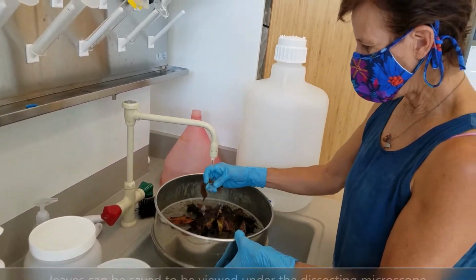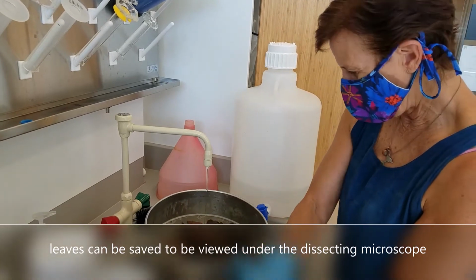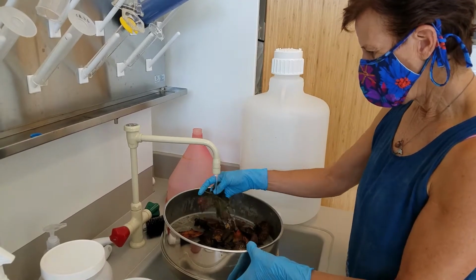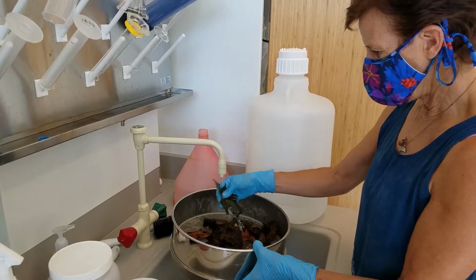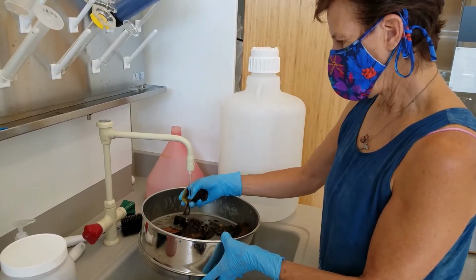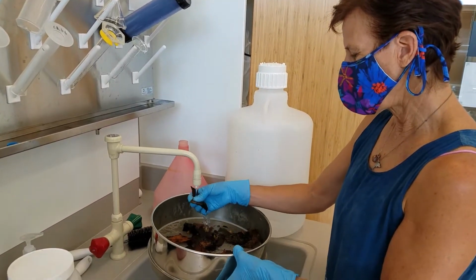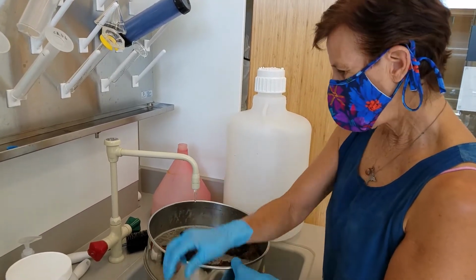You can keep the leaves if you like. Maybe I'll keep a couple of them. Get rid of some of the bigger ones. And then we can look at the leaves under the dissecting scope. And so you aren't going to see this kind of leaf matter in the freshwater tidal benthic samples or in the lake benthic samples.